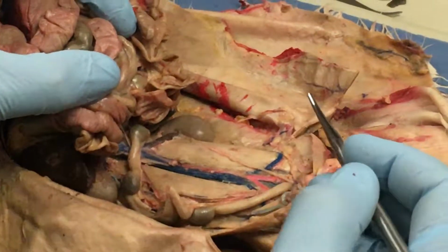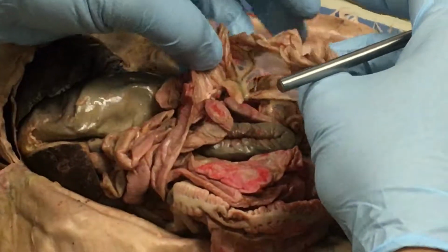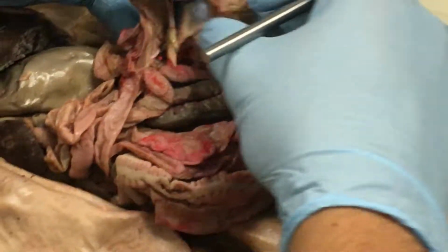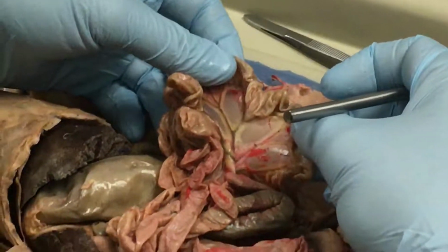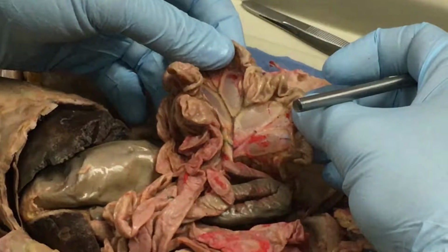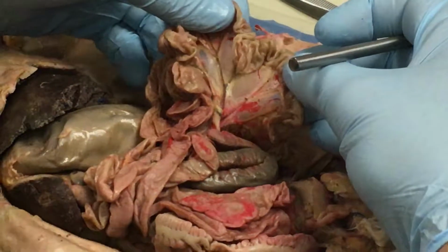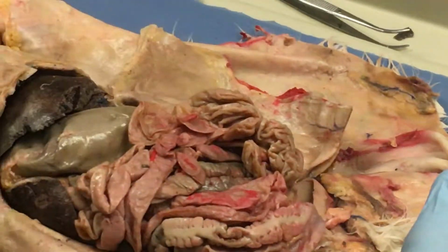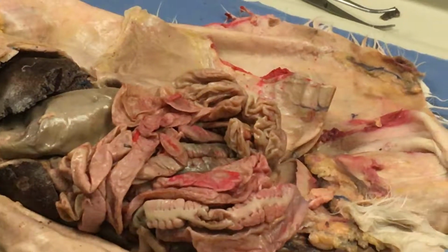And the true mesentery, when I show you that, that's this right here, this membrane here holding the intestines all together and holding the blood vessels and the nerves that work the intestines. But it also produces fluids to reduce friction, okay? So there's our membranes, and there is our function of the membranes. Questions about that?